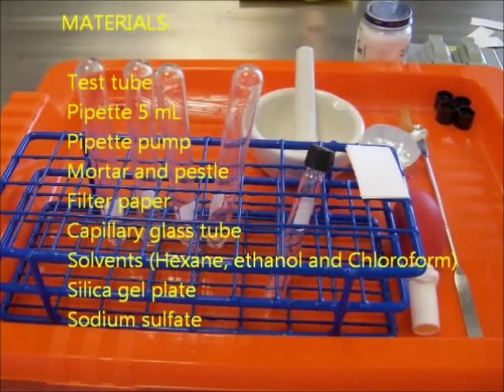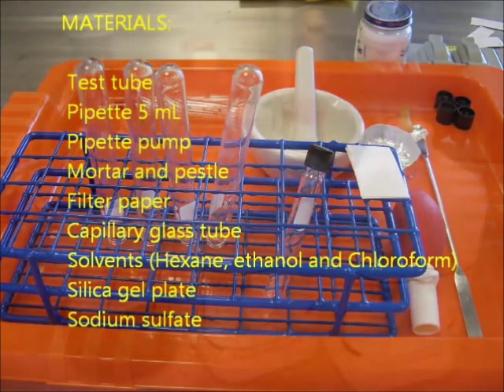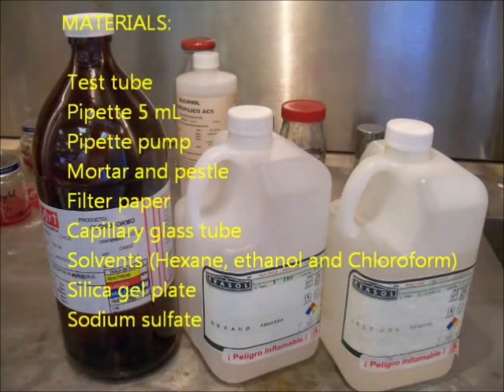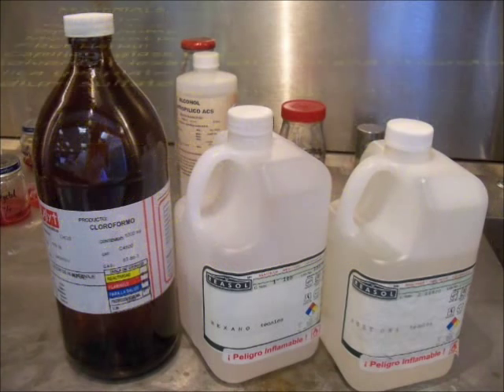Materials: test tube, pipette 5 ml, pipette pump, mortar and pestle, filter paper, capillary tube, solvents hexane ethanol and chloroform, silica gel plate and sodium sulfate.